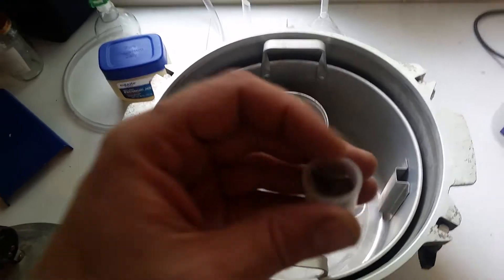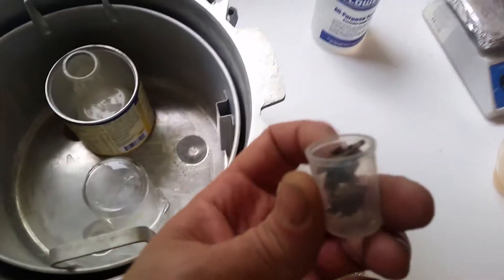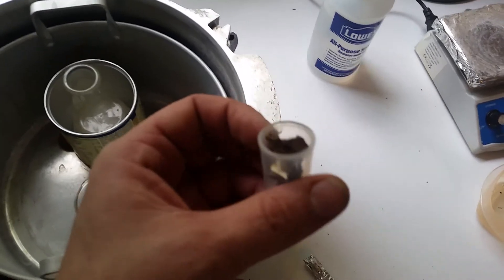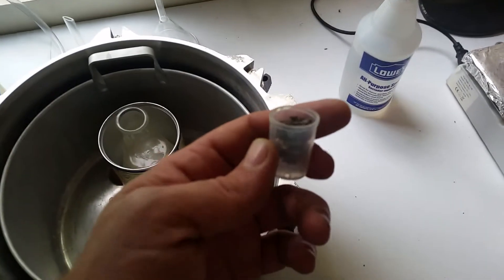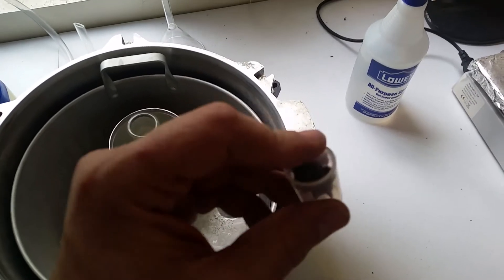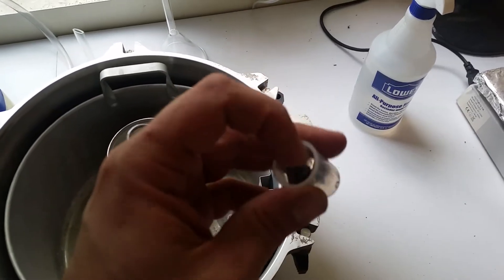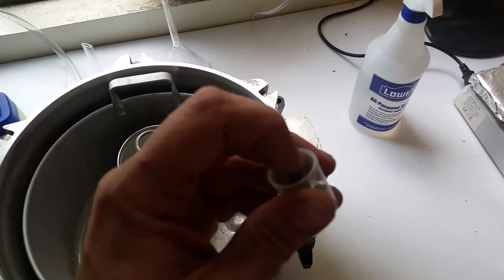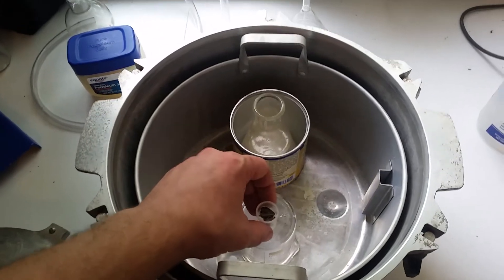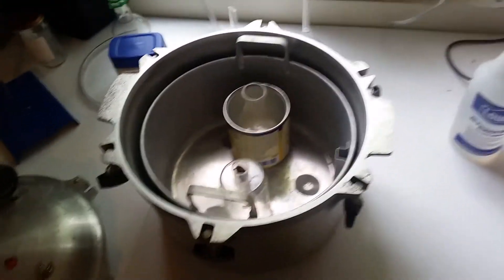From the last experiment, I believe there is a slight discoloration on these magnets. Focus. Come on. But it's very slight if there is any. And it's still fairly strong, or has a fairly strong attraction to each other. So it's not losing its magnetism either. So this is attempt number four. And I will pick it back up once I get it started.